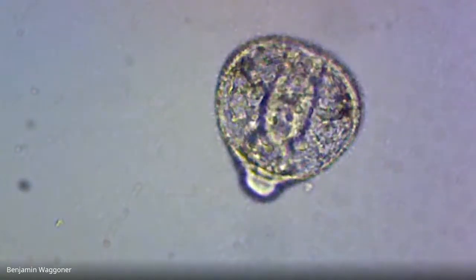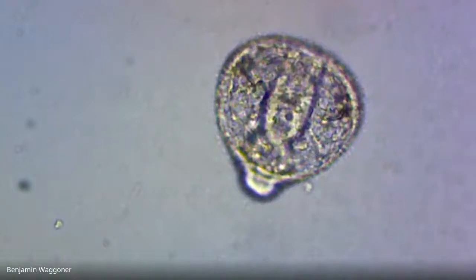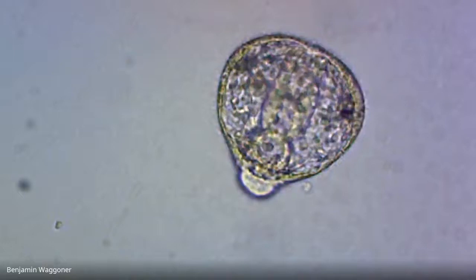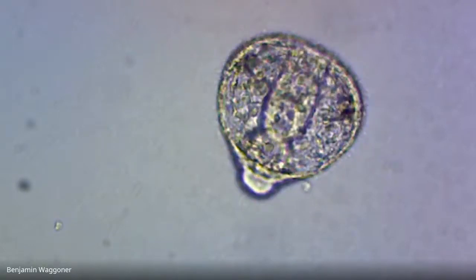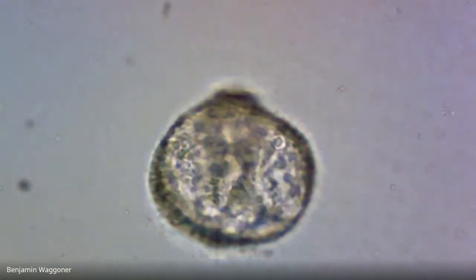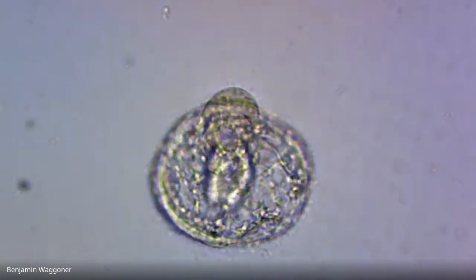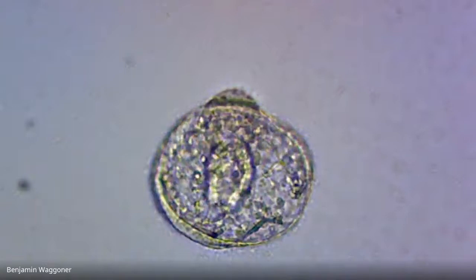Okay, that's another prism larva, and that one's not moving. You can see the anal end at about your 11 o'clock. Maybe I did show you that one before, but you can see that the gut's complete. If I did show you that one before, don't count it. So we're almost done. Okay, that's another prism at kind of a funky angle. That's a prism.